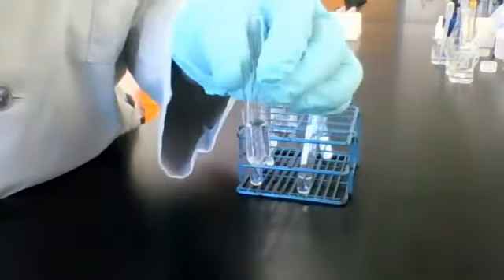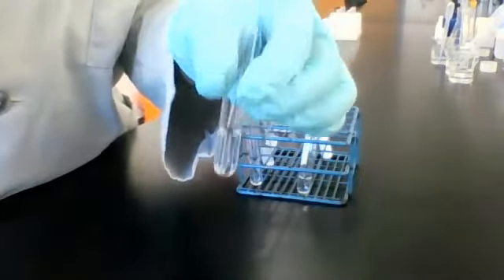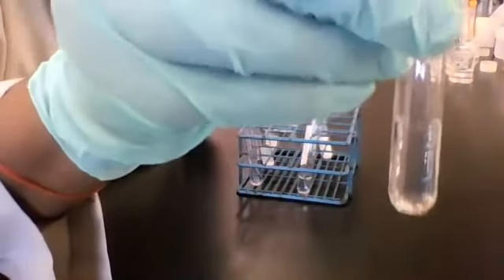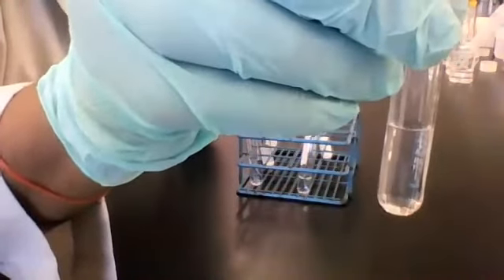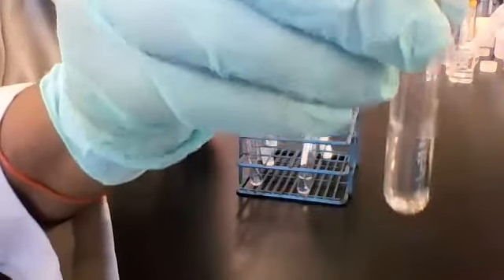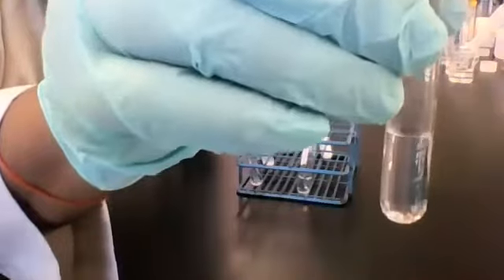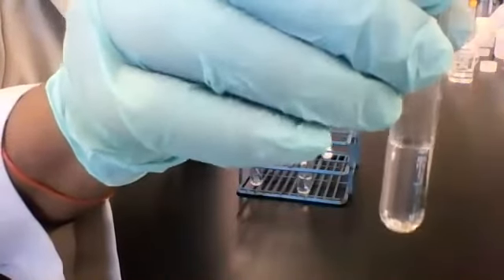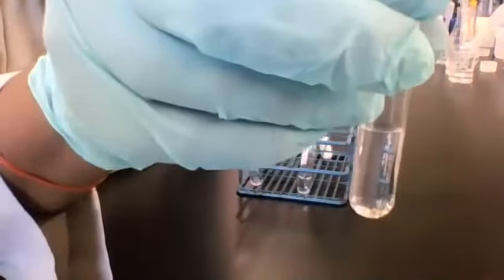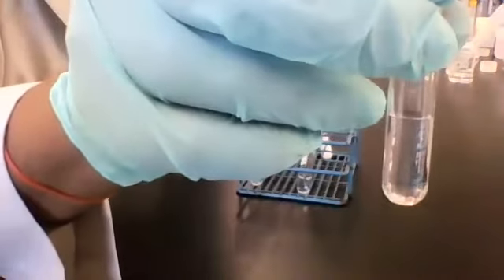I'm gonna tell you, you don't have to tell me. We just have an understanding, yeah? We know it's coming. So you write this observation here, if there is any observation to write. Ultimately, this one here is not going to help you figure out what reagent C could be, because it's just water. Water is gonna do that with all 3 reagents, but it's still important information.